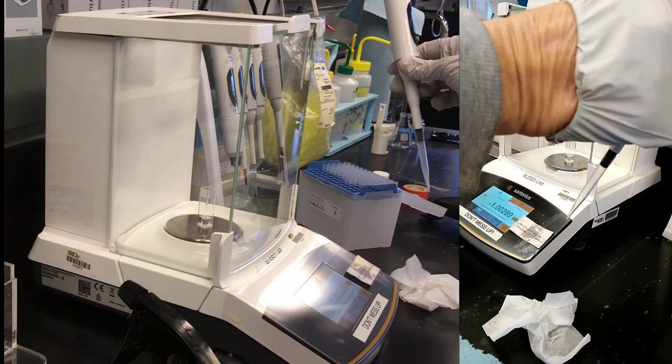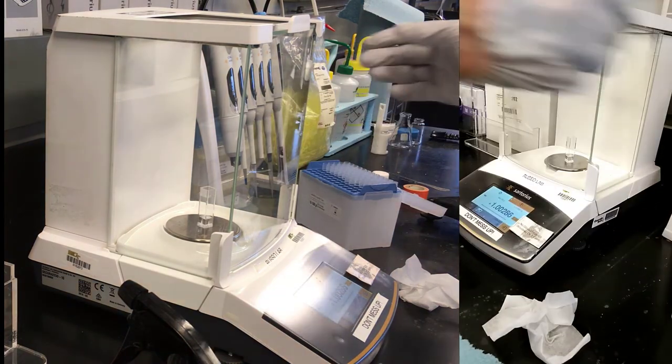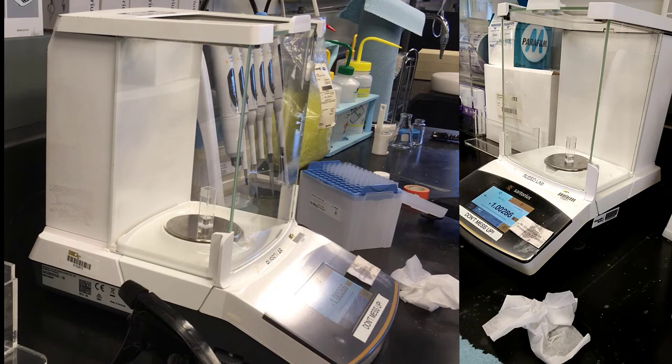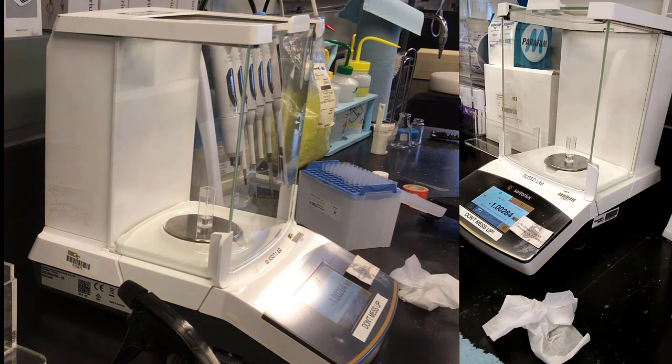Another rule of thumb is to put these things back in their rack. We don't like to leave them on their side because then the liquids get into the mechanism and it's not good. And it reads 1.00286, so that pipette may be a little bit heavy or the temperature of the water isn't exactly correct, probably. That's pretty good though. That's 2 parts per 1,000 error, if it's an error at all.